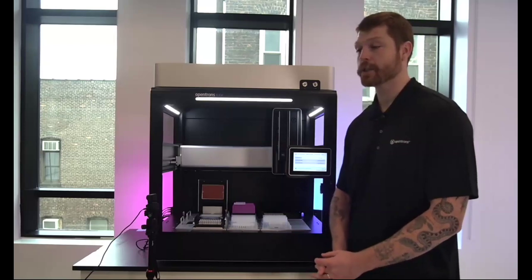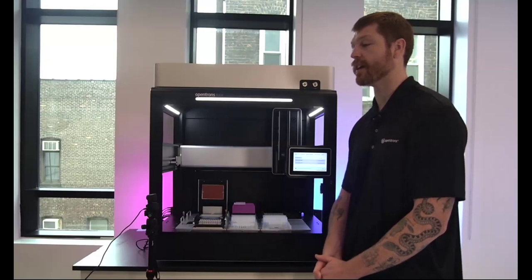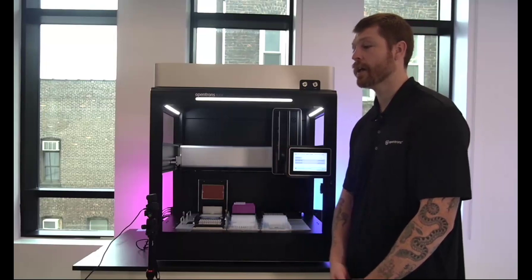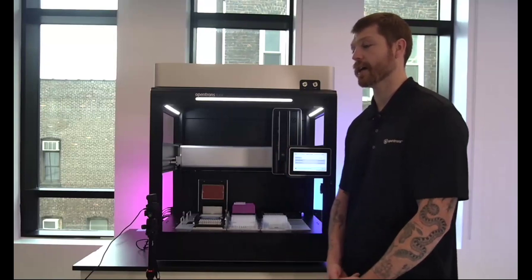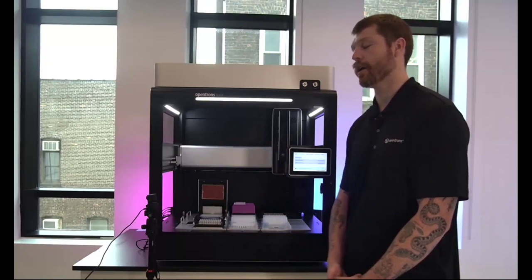Okay. Is the HEPA UV module available for the OT-2 or just the Flex model? So there is a HEPA module that's available for the OT-2. It does not have the same UV compatibility. Its footprint is quite a bit different, but both do have a HEPA unit that is able to be configured to the top of the instrument. And then the Flex, as I mentioned, just has 2 UV bulbs, which the OT-2 does not.